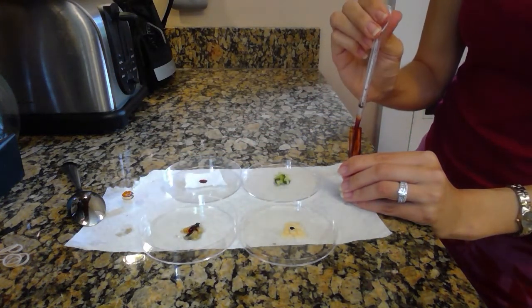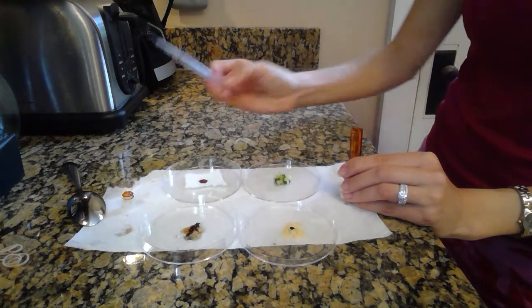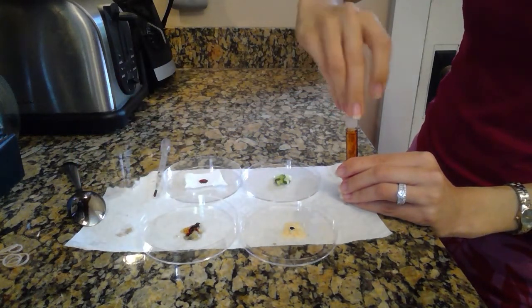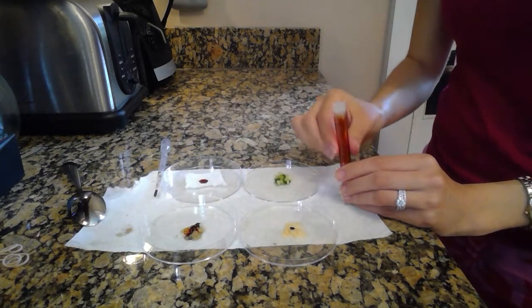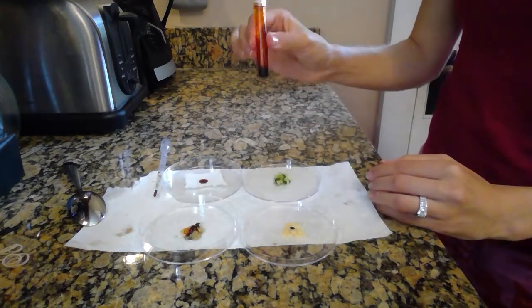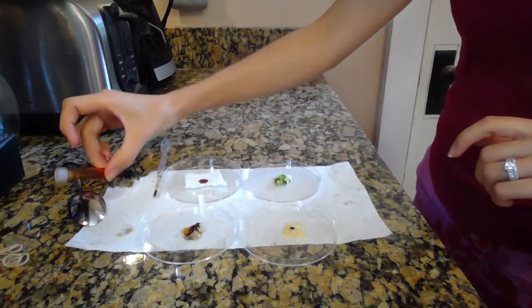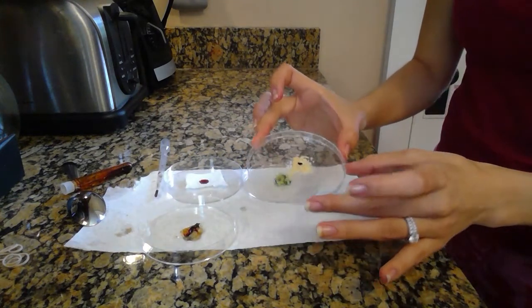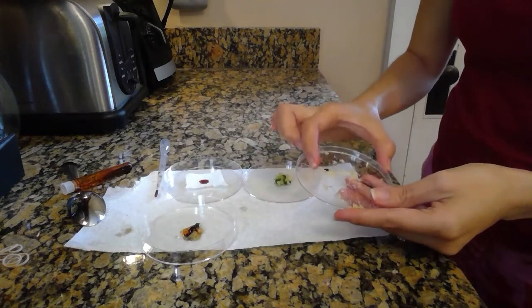I'm going to record what they look like at this point. I'm going to set my stopwatch, and then I'd come back in 2 minutes and record what it looks like then. Now you're looking for a color change to tell that starch is present. So your color to start with, of course, is that deep reddish brown. And so once you see your samples, you'll notice some of them might turn an interesting color, if you can see that. Oh, that's what I was trying not to do. Okay.